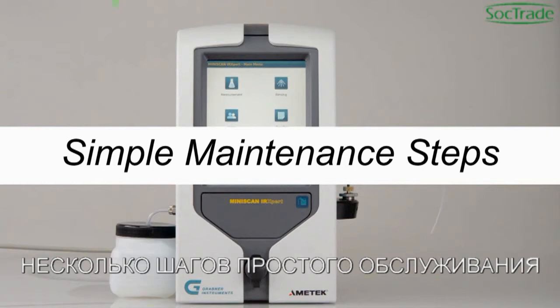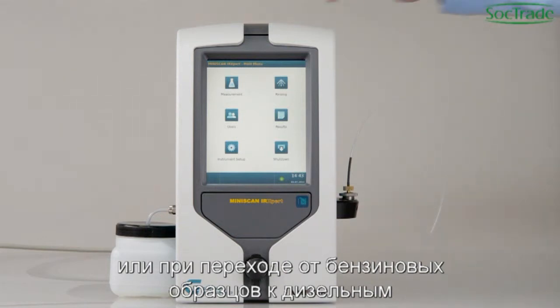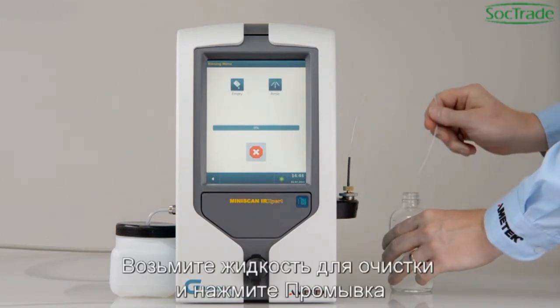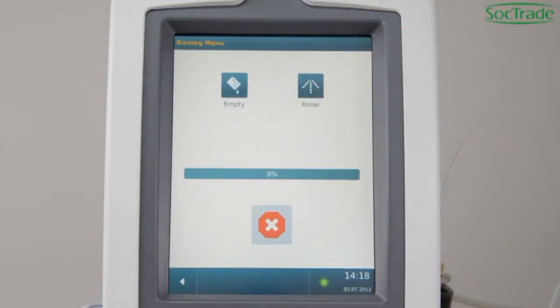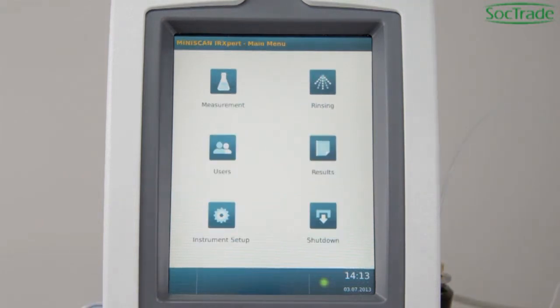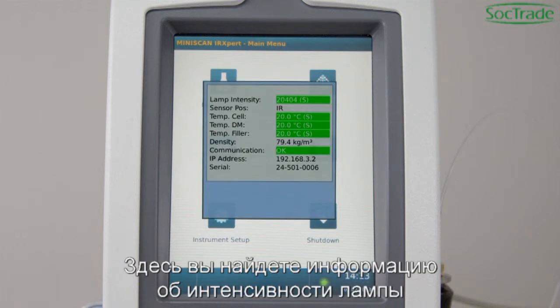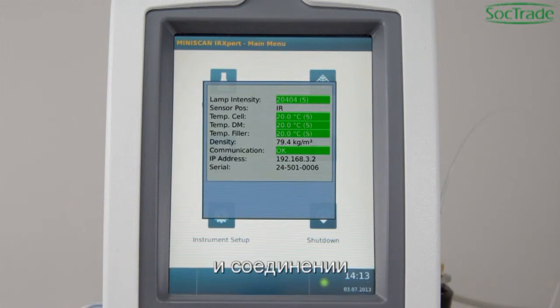Simple Maintenance Steps. Before you turn off the instrument, or if you switch between gasoline and diesel samples, start a rinsing cycle for cleaning. Attach a cleaning solution and press Rinsing. Finally, perform a rinsing with air. By clicking on the status indicator at the bottom of the screen, you can always check the analyzer status. Here you will find information about lamp intensity, sensor position, temperatures, and communication.